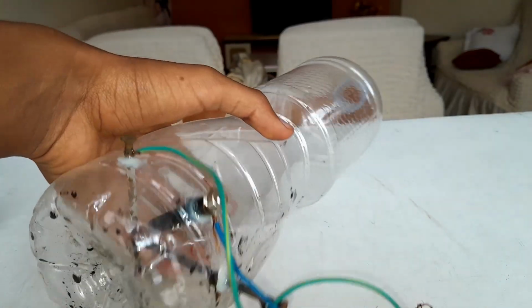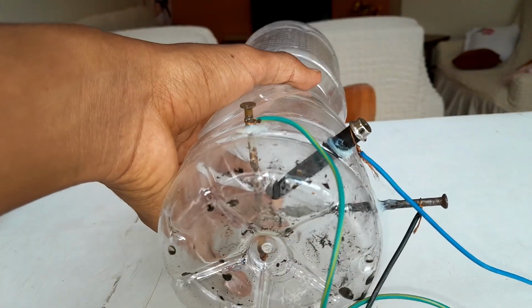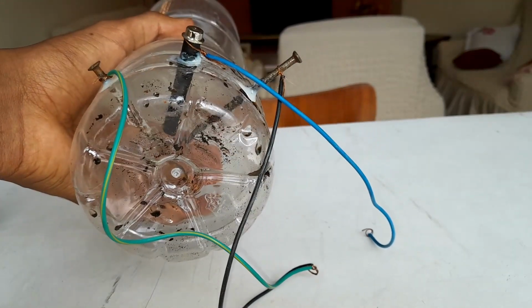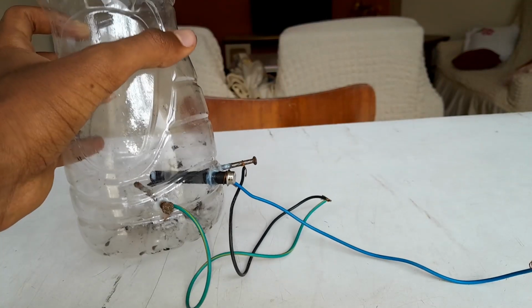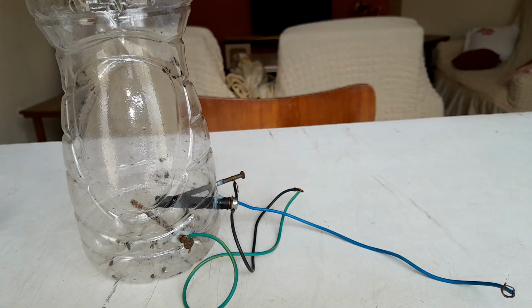So right here I made a flask and I inserted three electrodes at the bottom. Two are connected in parallel, and the cathode is the single one, as you can see here. Now the aim is connecting it to a much more powerful source, like a laptop charger. Honestly, that's the only thing I have next to a car battery. So we're going to use that and see what happens.